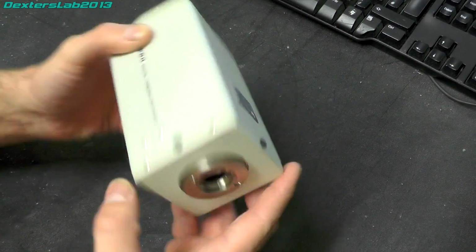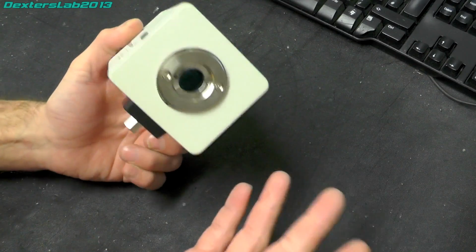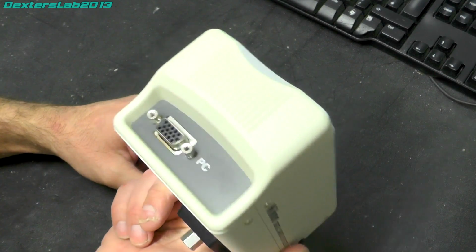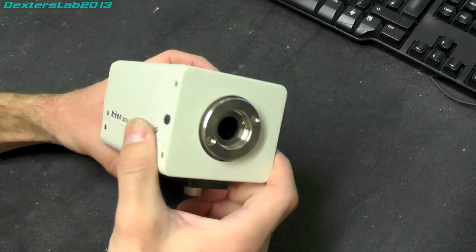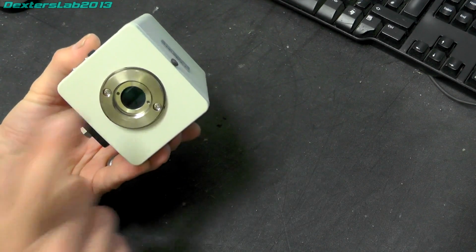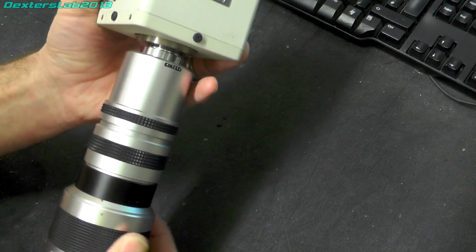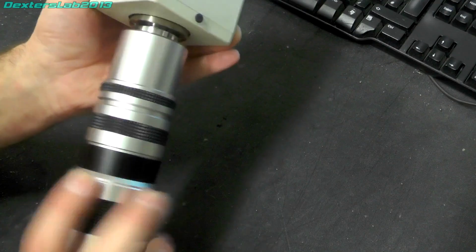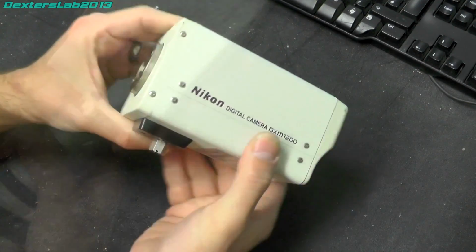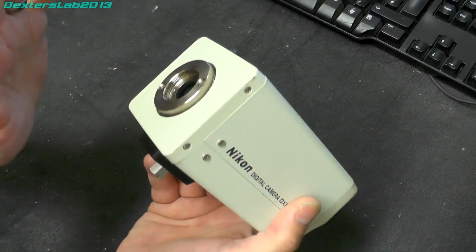So I've only got the camera on its own, so there's probably little chance of me actually being able to use this. The interface cards are available on eBay, but the sellers just want crazy money, like $600 for one of the interface cards. It's like, you're having a laugh. Incidentally, the lens mount on this is just standard C mount, so you could potentially screw in pretty much any C-mount lens onto this.